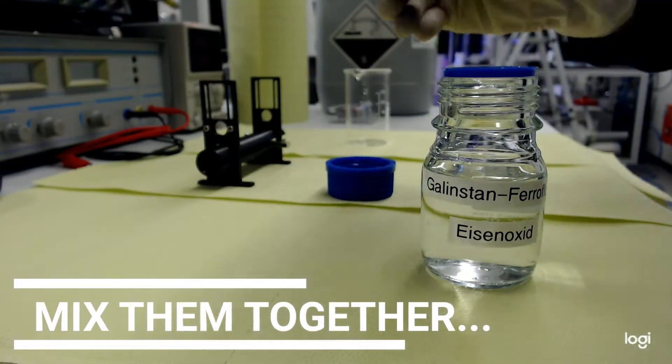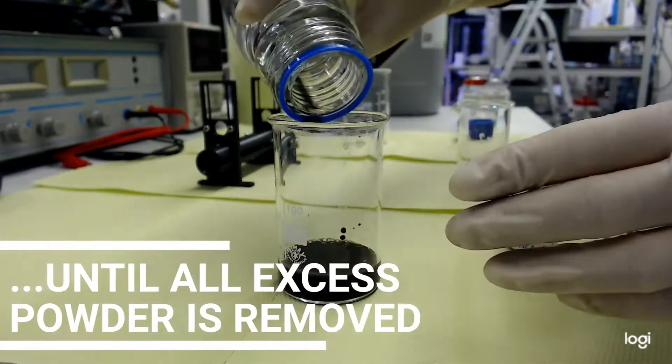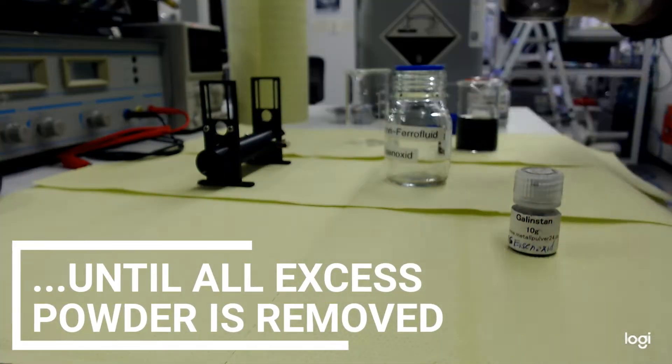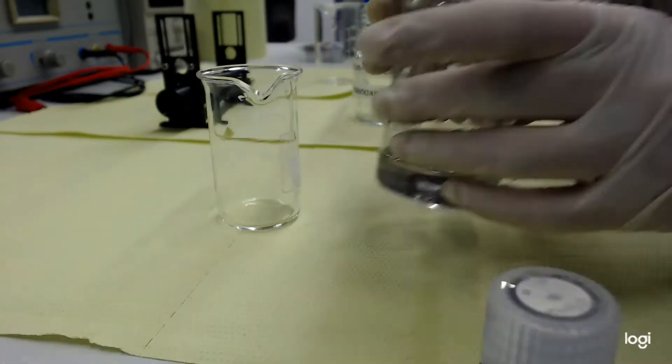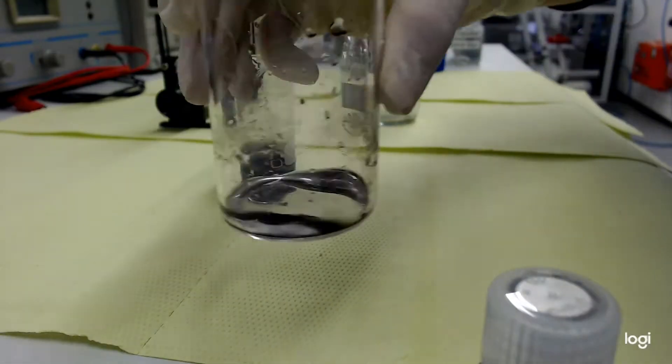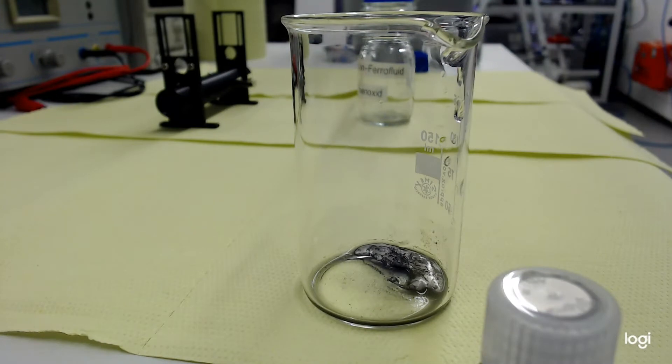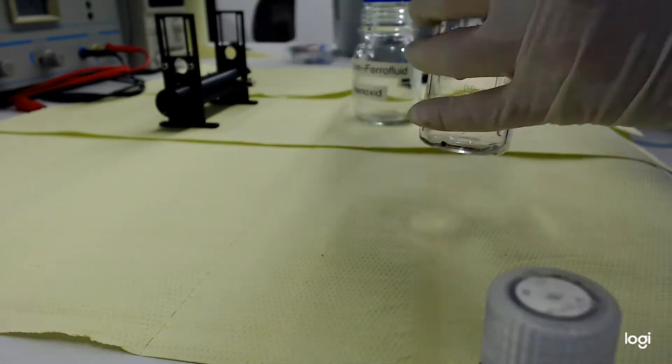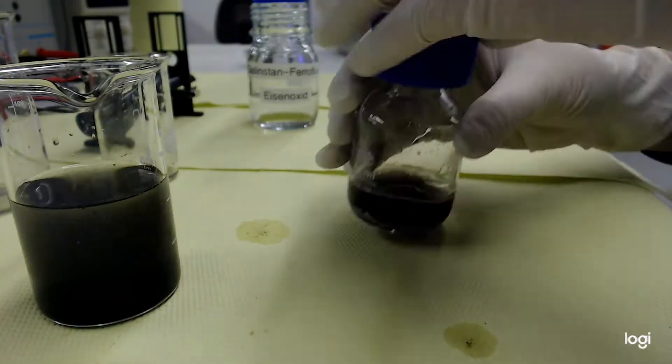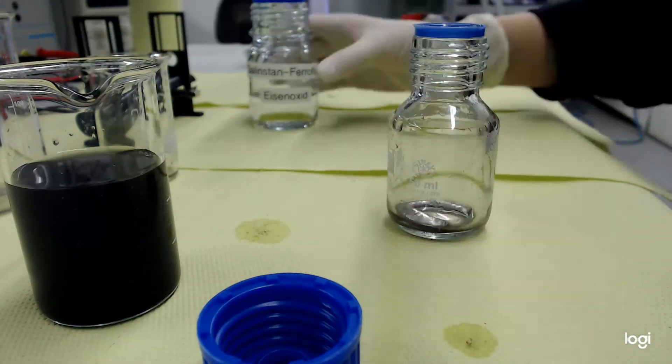The process is repeated until no dust is further visible in the solution. A lot of hydrochloric acid is used in this process. The process can be accelerated by shaking the bottle further.